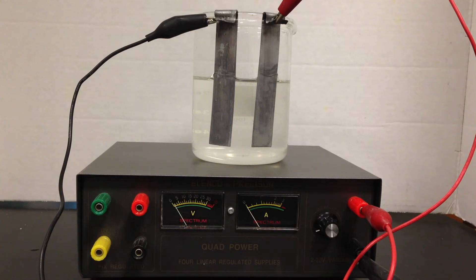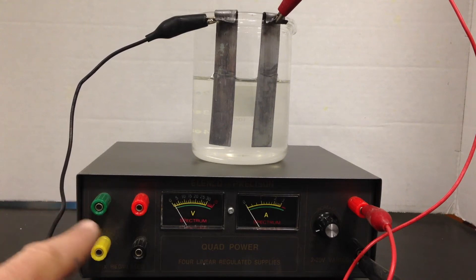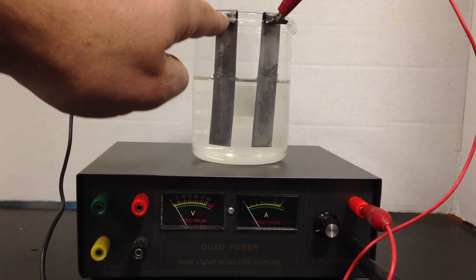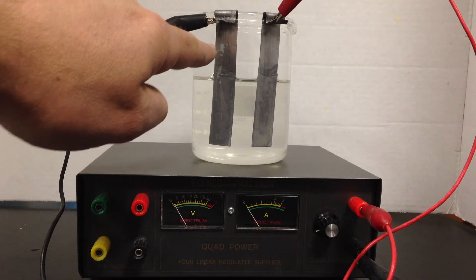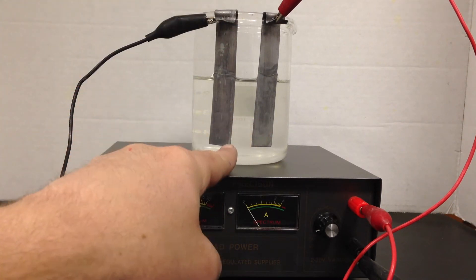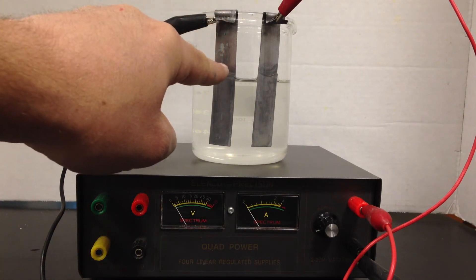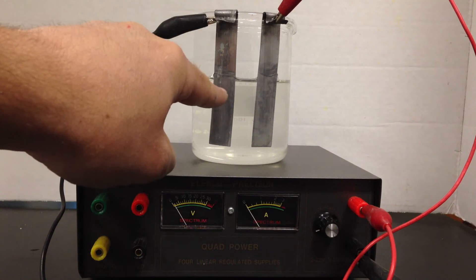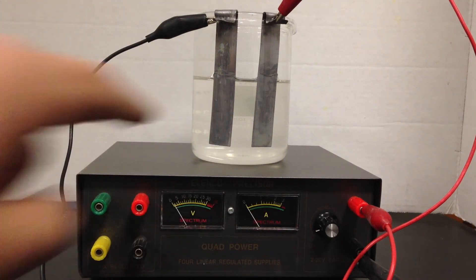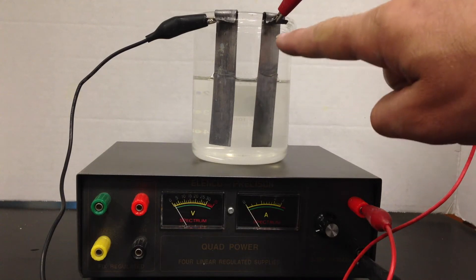Nothing is happening yet because I haven't turned the battery on — this is a non-spontaneous process. The anode of the battery is negative, which makes the cathode of the electrolytic cell negative. As we know from 'red cat,' the cathode is always the place of reduction. So lead²⁺ ions in solution are going to gain electrons pumped from the battery, and solid lead metal will be plated onto the cathode electrode.